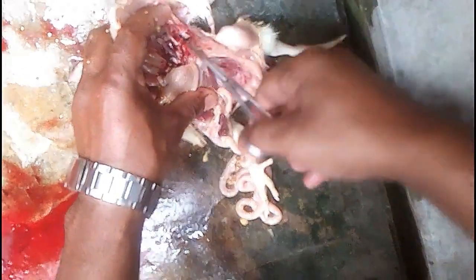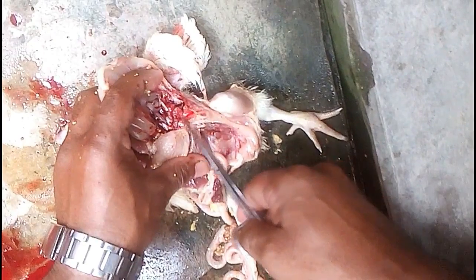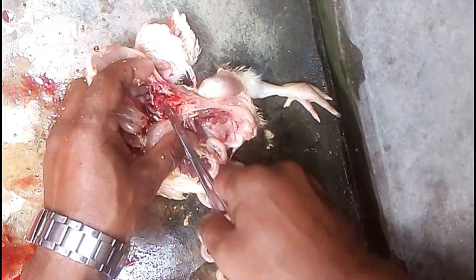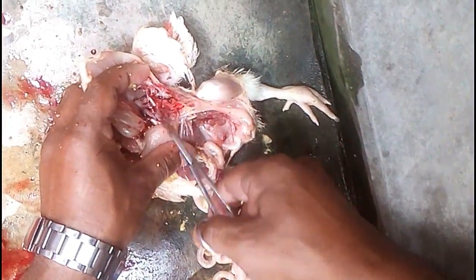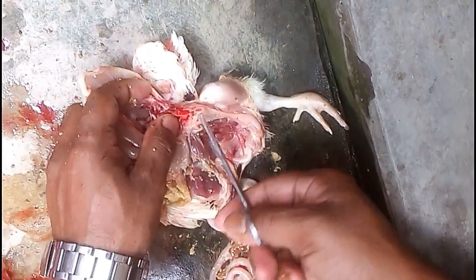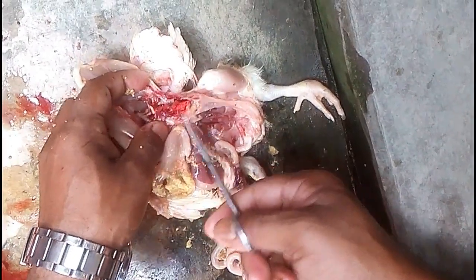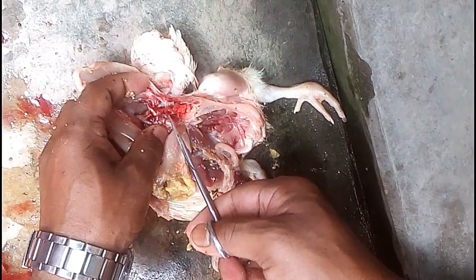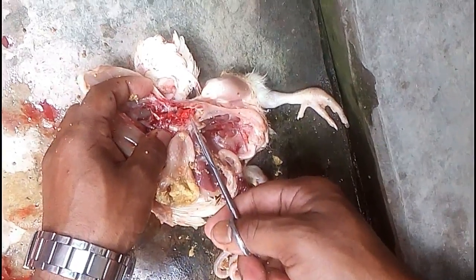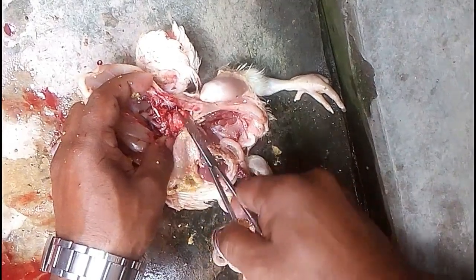This is the lung. The colour of the lung is okay because there are no respiratory problems in this bird. This is the fresh colour of the lung, and this is the normal colour of the lung — so they can be easily compared.